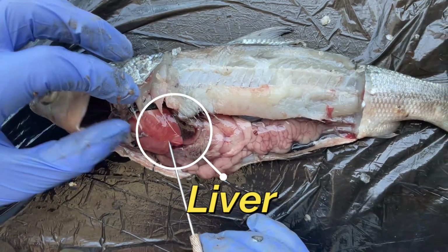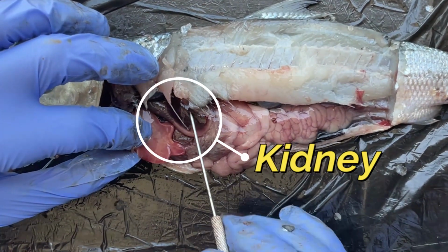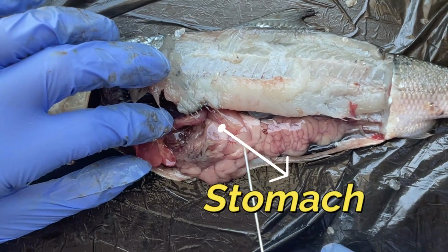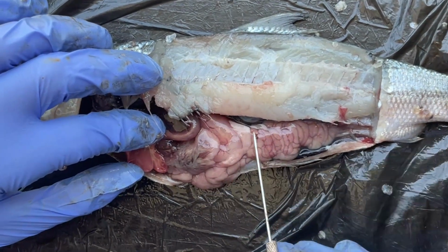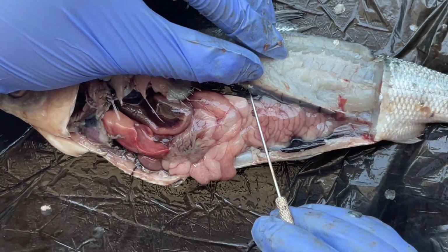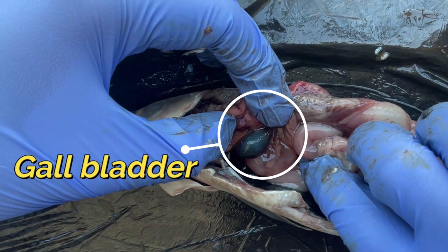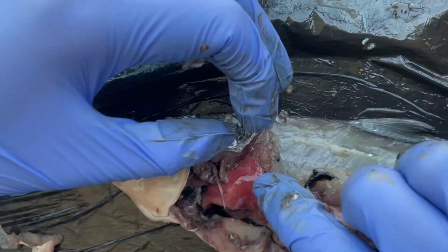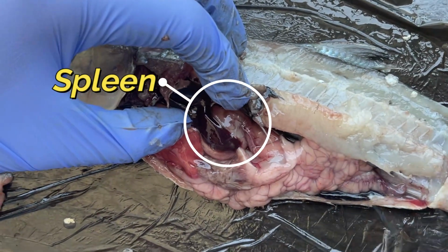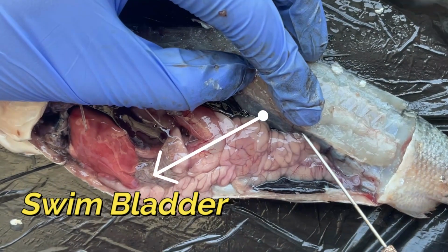liver, stomach, intestine, aorta, gallbladder, spleen, the swim bladder.